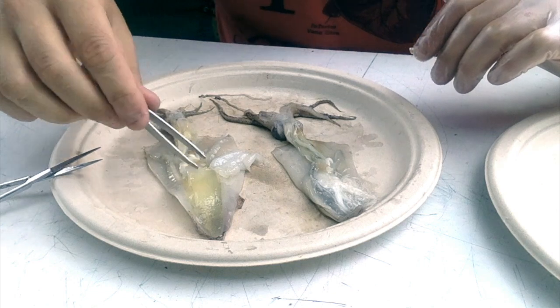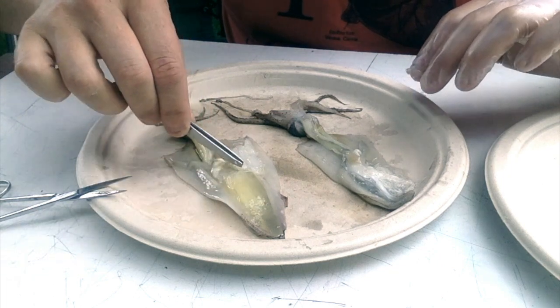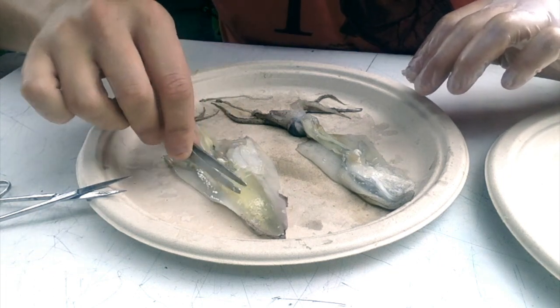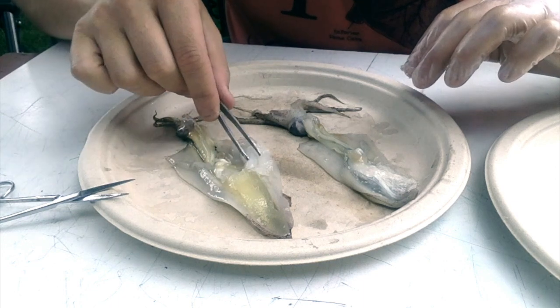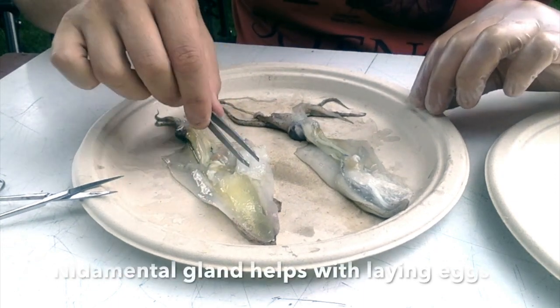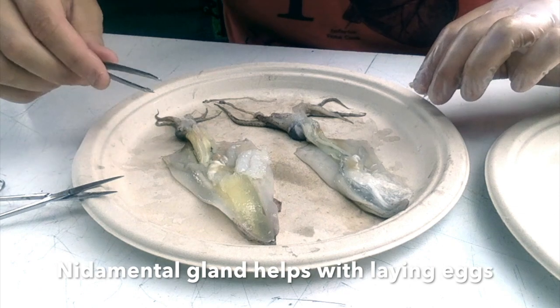So, when we look at this specimen over here, we've got a very clear identification as a female because there's this sort of yellowy, somewhat transparent, gel-like looking mass that would become the eggs. And you can see that the male doesn't have this large gland here. This is called the nidamental gland, and that's very important for female reproduction.